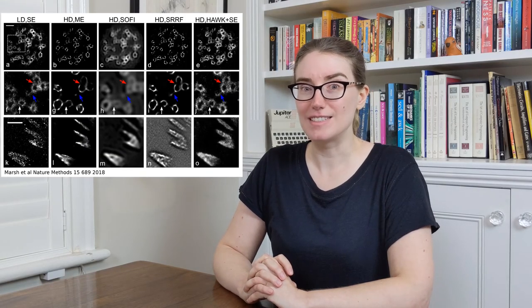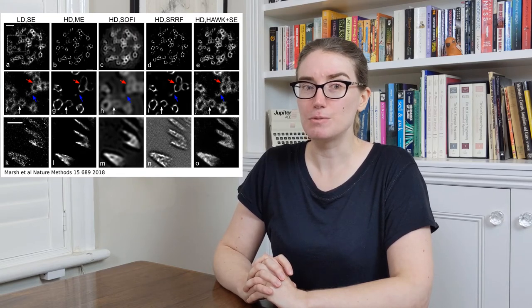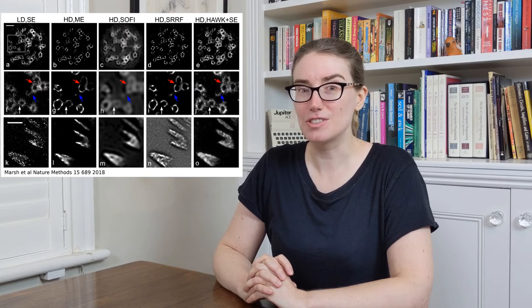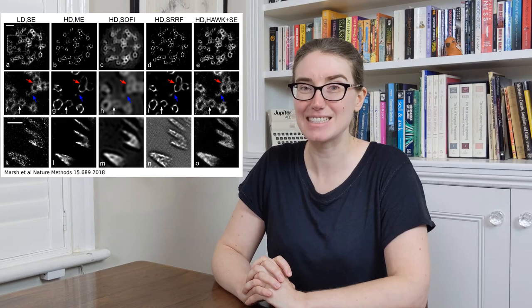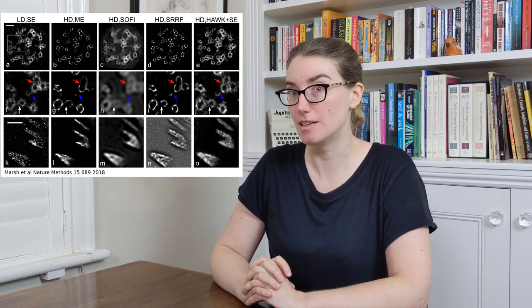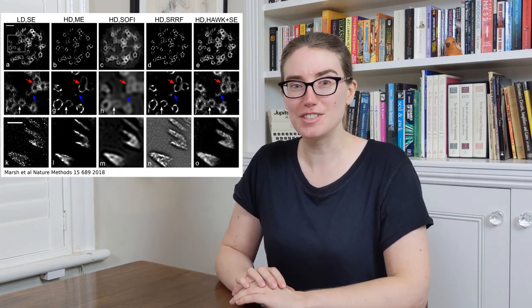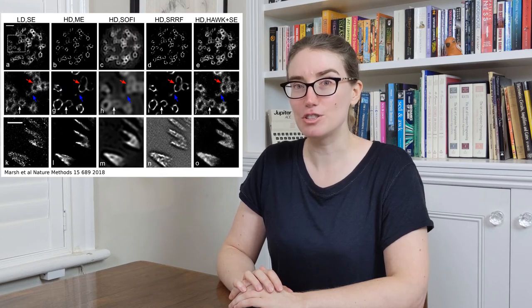As you can see, the column on the left, which is low density data, shows the same structure as the column on the right, which is the HAWK data. For focal adhesions, we weren't able to get a very high reconstruction density from the low density data because there's a limit to the amount of time you can hit a cell with a 405 nanometer laser and describe the results as representative or even live cell. Even so, you can see when you compare to the results other methods get, the lack of artificial sharpening and the good reproduction of the structure.